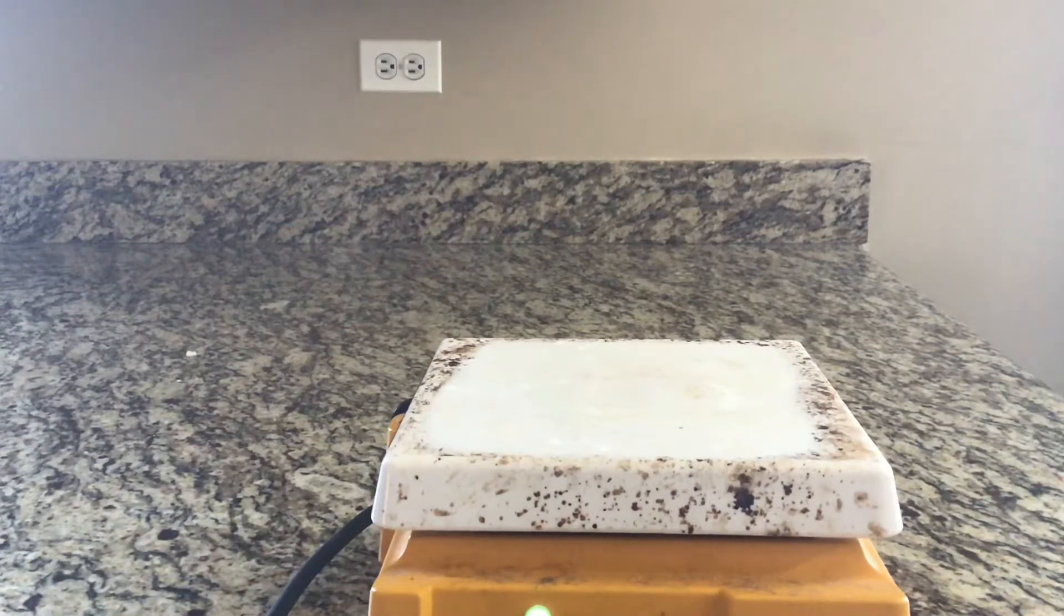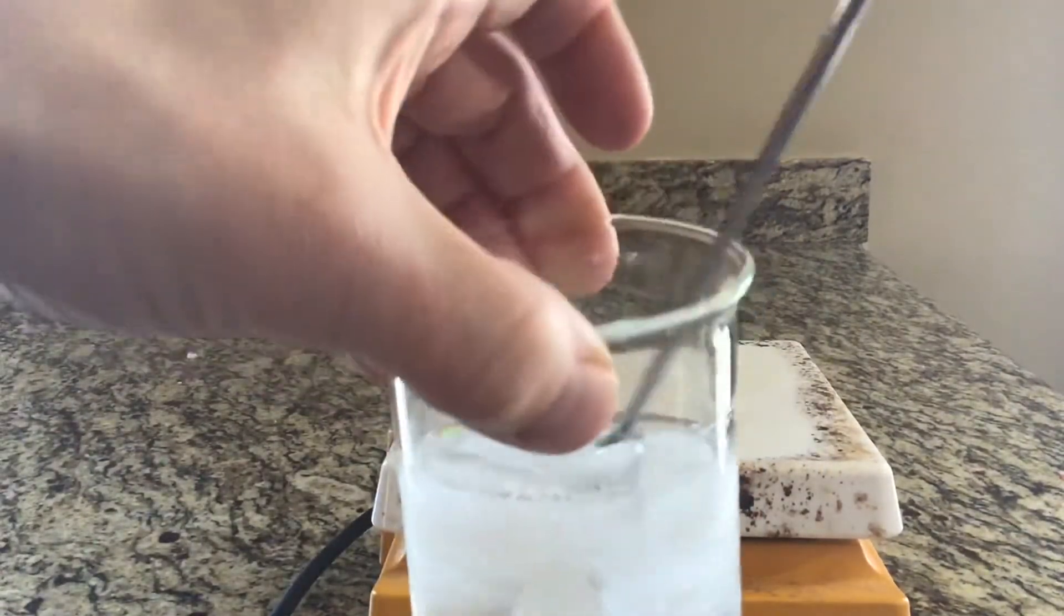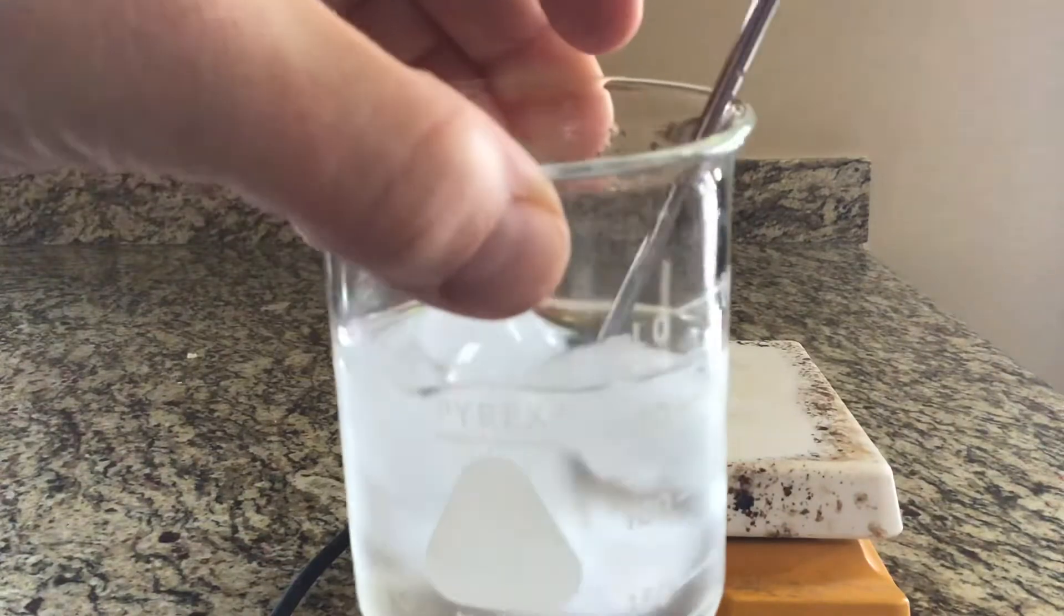All right science fam, we are going to be doing the heating curve of water lab. What I have so far is just a beaker full of ice water, so there's actually ice and water in there.